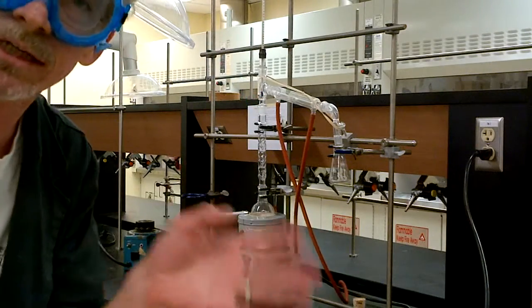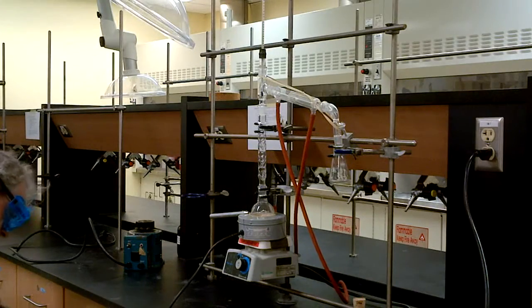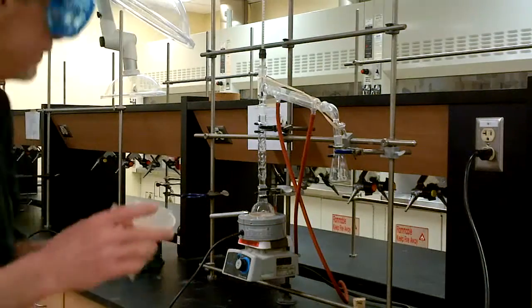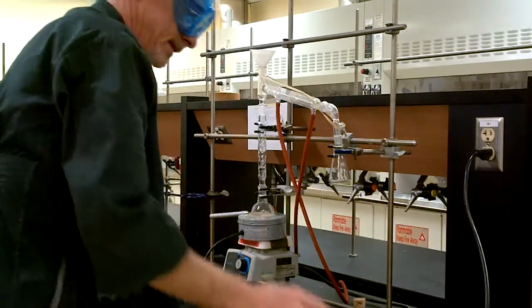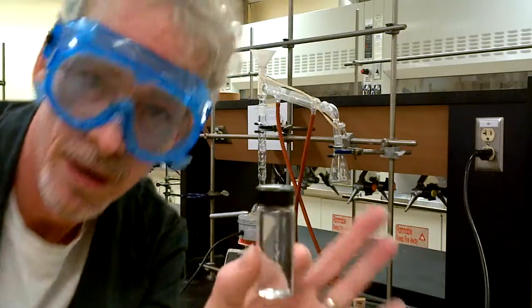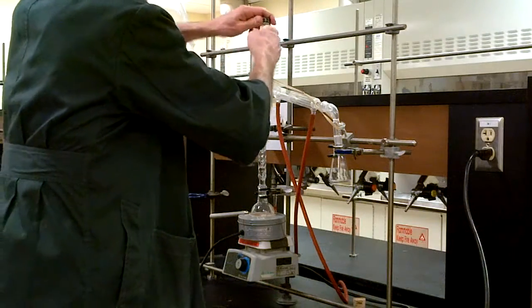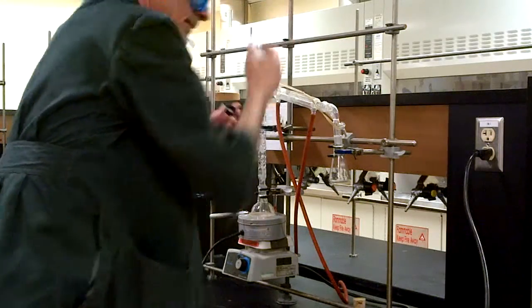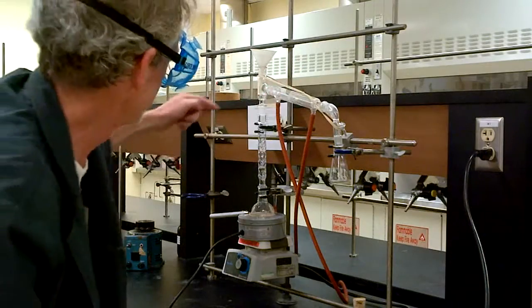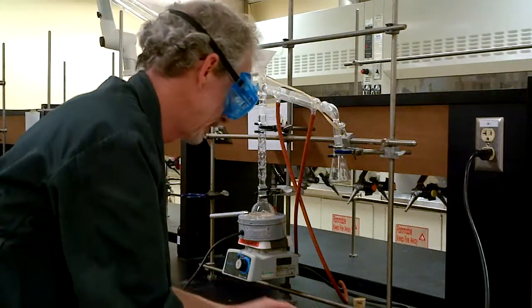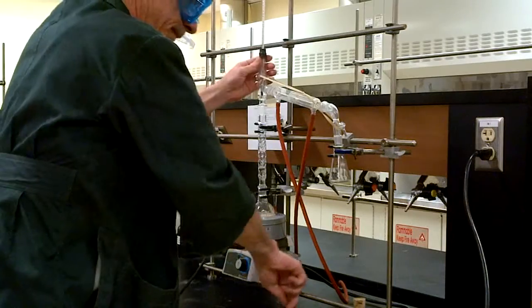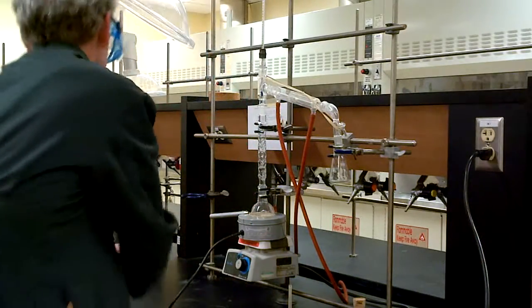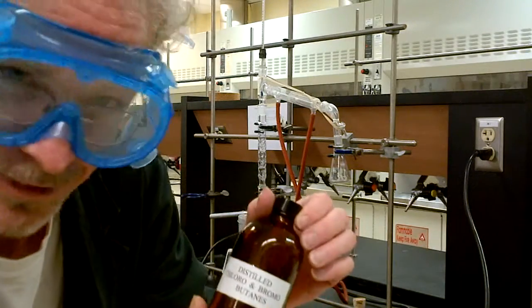And I have my completed apparatus. Of course, using a long stem plastic funnel, pop that in there. Your product from week one. And it goes. The long stem funnel makes sure it goes all the way down. At this point we can replace the thermometer.